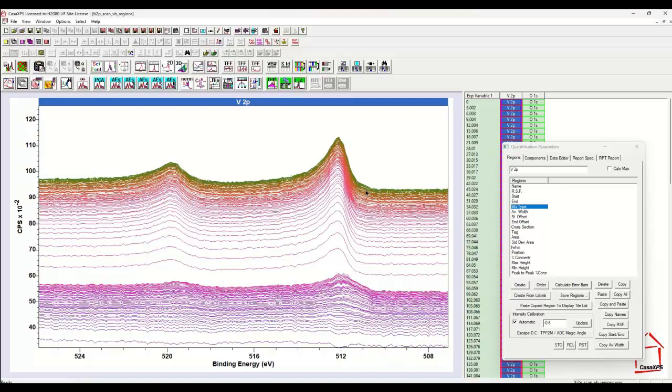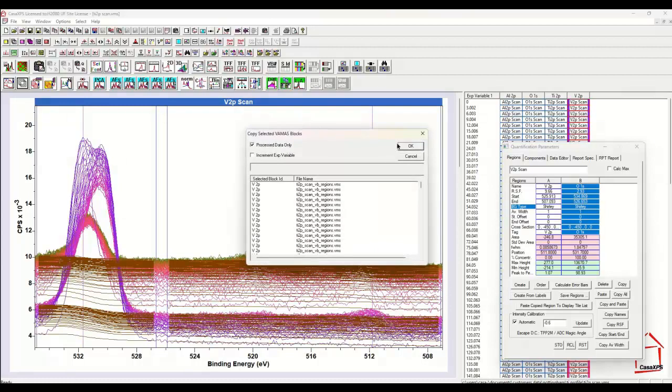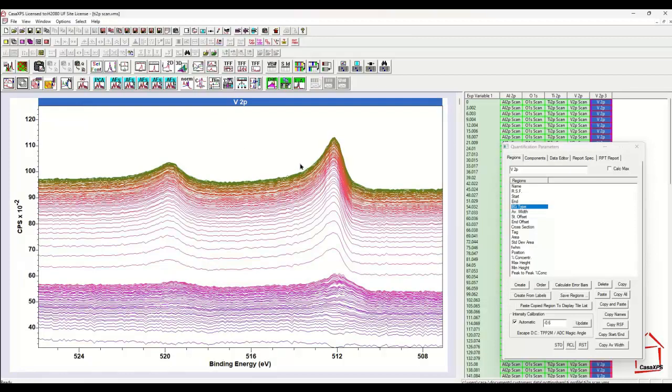We can see the enhancement has occurred, and then if I copy back to the original file using the toolbar button that is designed to produce a copy of the data that is the process data, not the original data. So this will take through the abstract factors enhanced data, and it will also add a number to the element transition fields which appear here, and therefore the new data will then appear as a new column in the original file. So now I have a column that represents the signal enhanced vanadium 2p, and this now can be included in the calculation of the depth profile and should produce a smoother trace in the profile as a result.